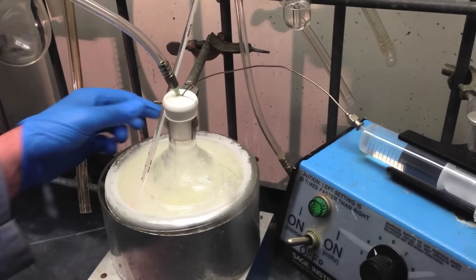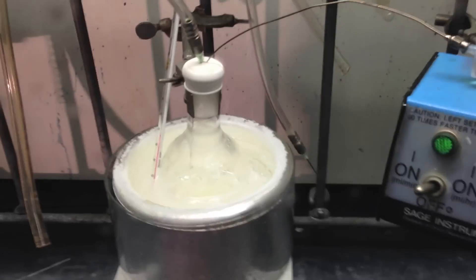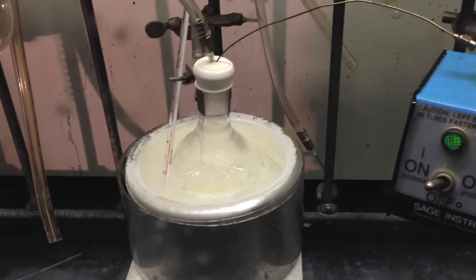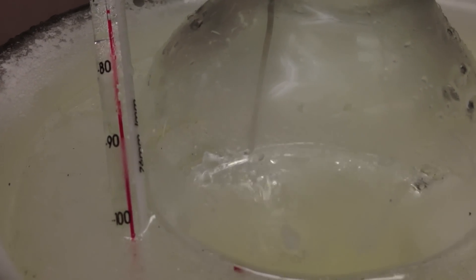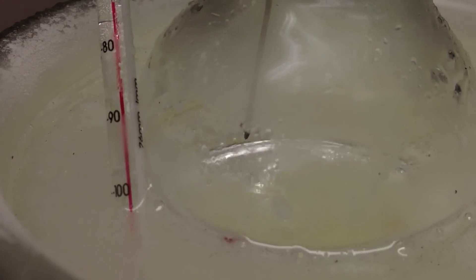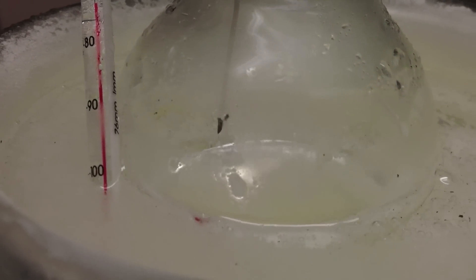In a few moments you'll start to see liquid coming from the syringe — what's happening is the plunger is being very slowly pressed in. We're going to allow the syringe pump to add all the contents of the syringe, all the methyl-lithium, to the reaction mixture, and then we're going to let it stir and warm up to room temperature overnight. Tomorrow we're going to check back and see what we've got.